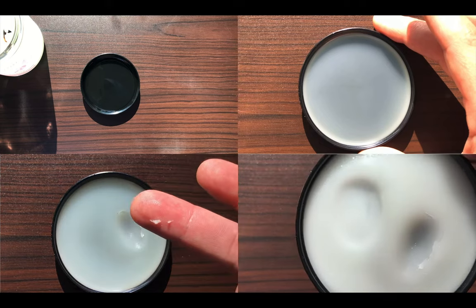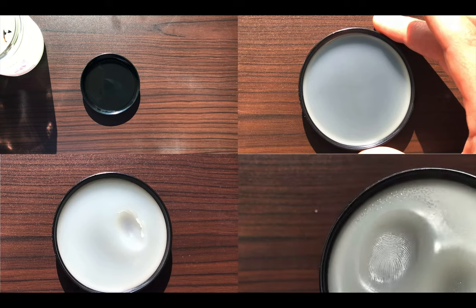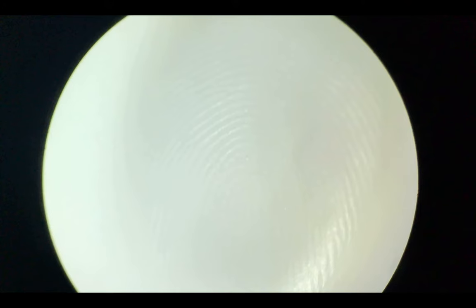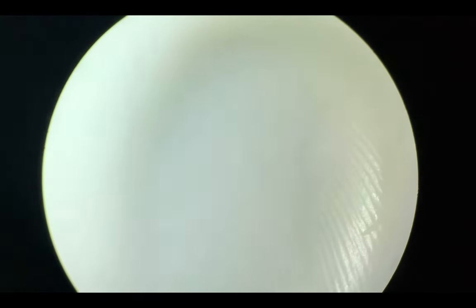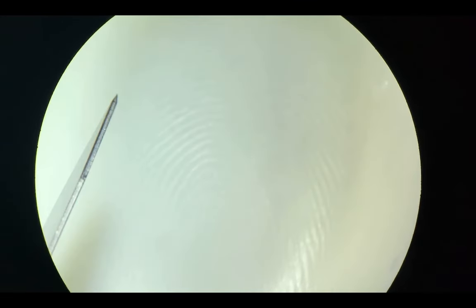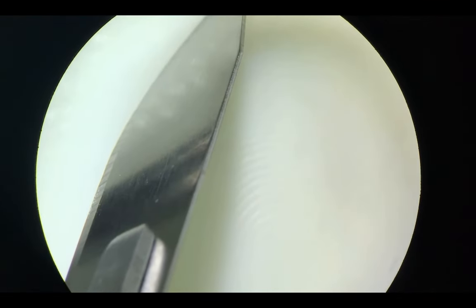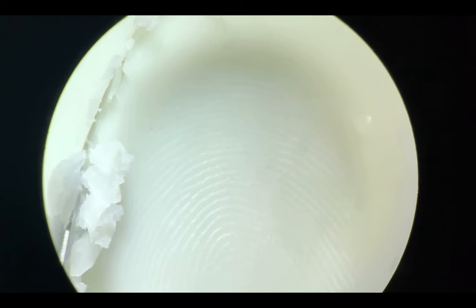So I took this wax, this plastic print, and put it under the dissecting scope, and it didn't come out as well on your computer screen as I was hoping, but it was still pretty cool. You still got this 3D image which holds a lot more information than any two-dimensional print can hold, because you got 3D now.